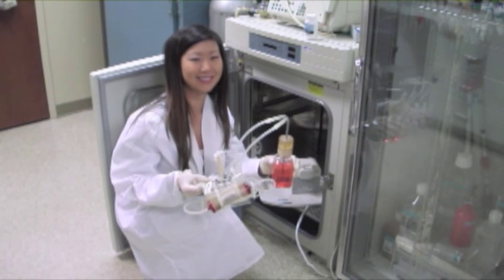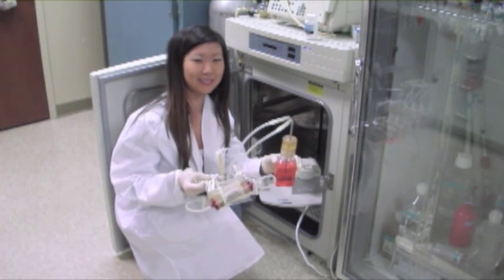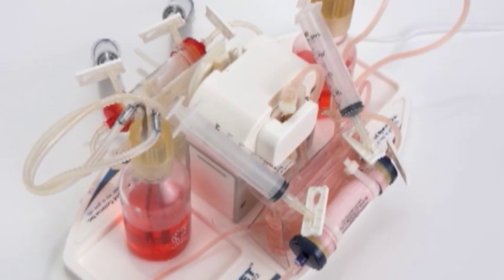A hollow fiber bioreactor system will allow any laboratory to culture more cells in a smaller space than is possible using any other method.